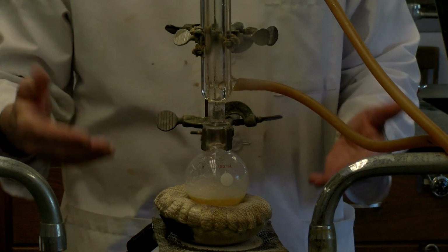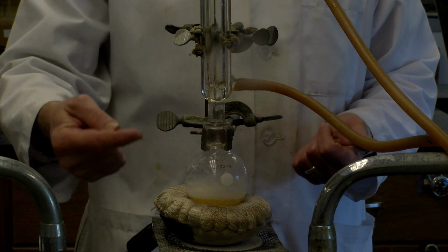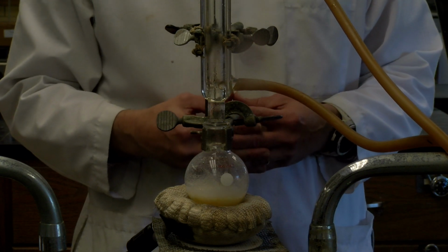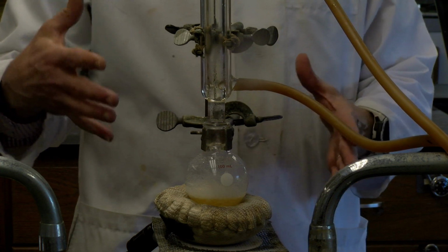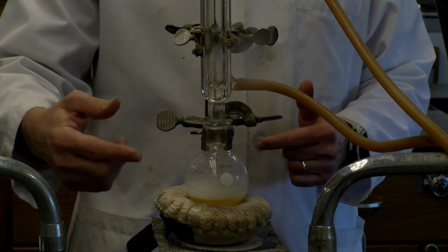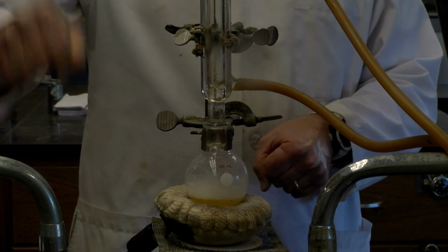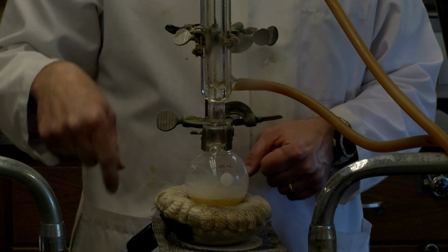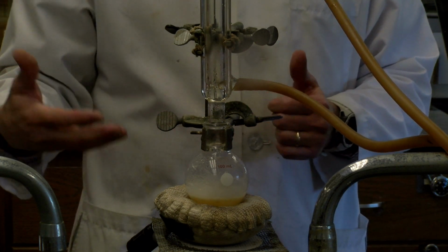Now, this idea of reflux, heating up, refluxing, condensing, and going through this cyclic turn is probably something that you know, probably in the kitchen, if you've ever cooked. If you cooked rice, typically you heat the rice up and then you cover it with a lid, or maybe put aluminum foil over it, so you're not letting the water out. If you're cooking some sort of vegetables, oftentimes you'll put a lid on the pan with just a little hole so the pressure doesn't build up, but basically allowing that water to condense so you heat up the vegetables.